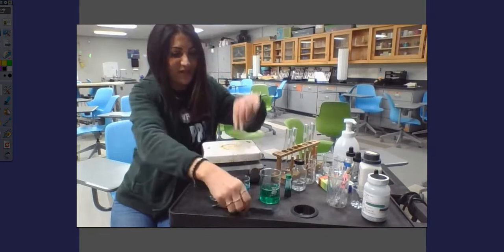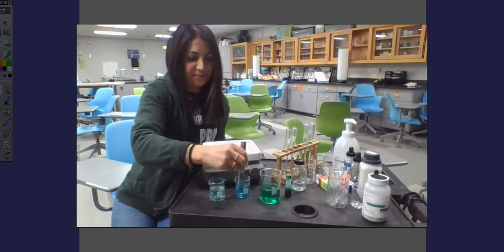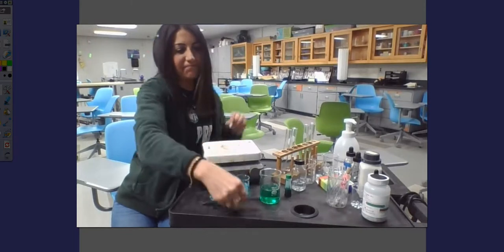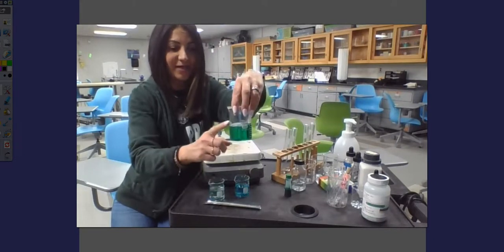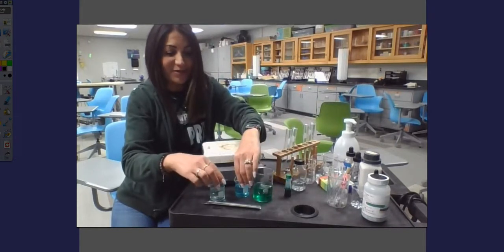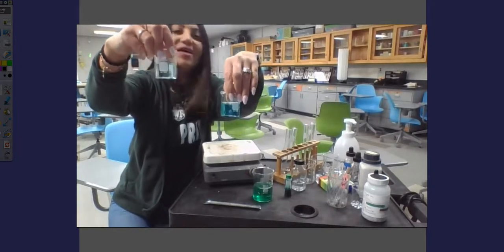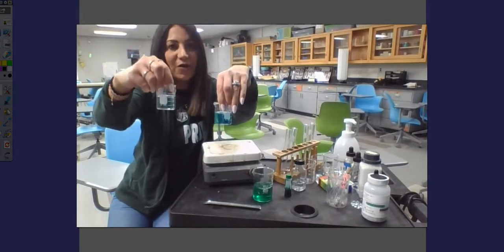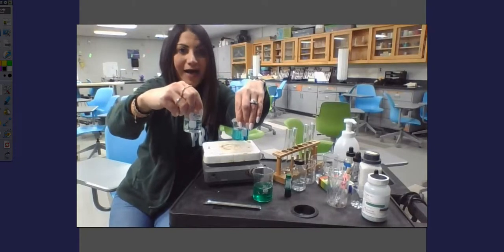And let's give it one more stir here and see what happens. You can see this is the color that it originally started at, this green color. And so these chemicals are at work. Oh my gosh. This is practically clear now. This is in the hot water. We know that this reaction definitely happened a lot faster. Why is it happening faster?